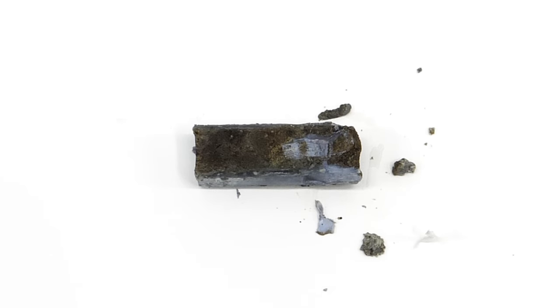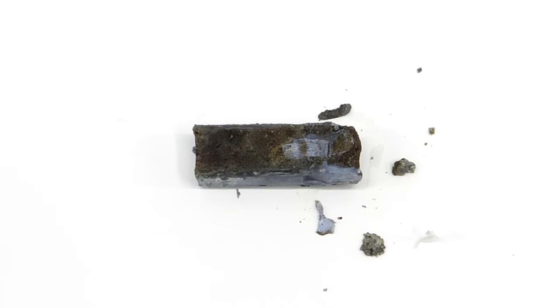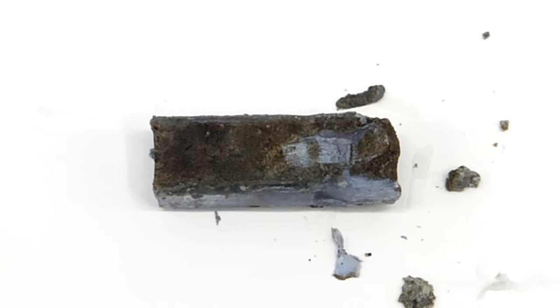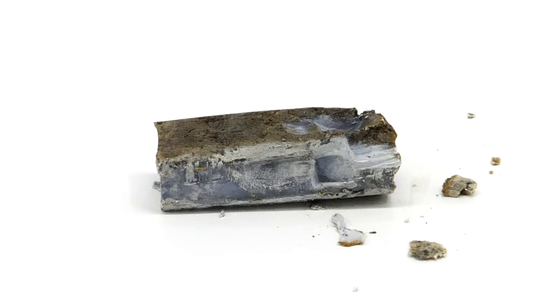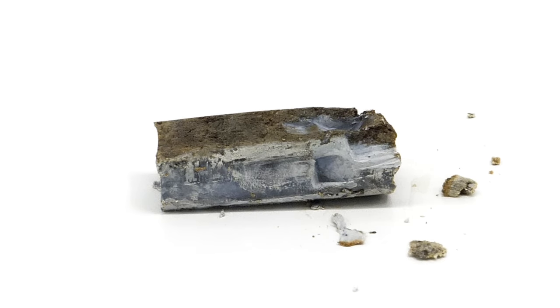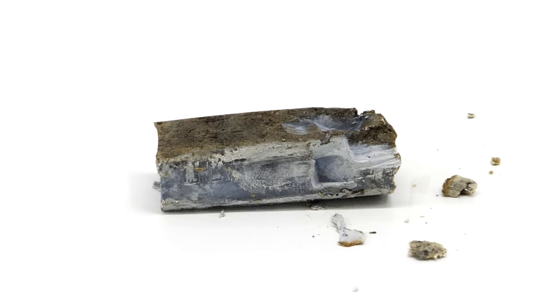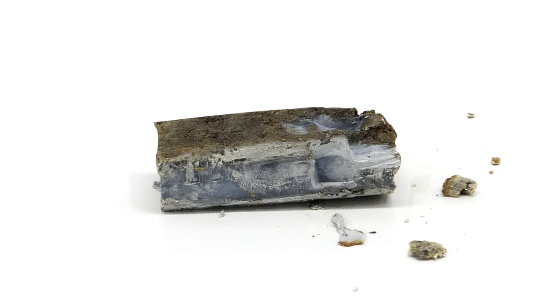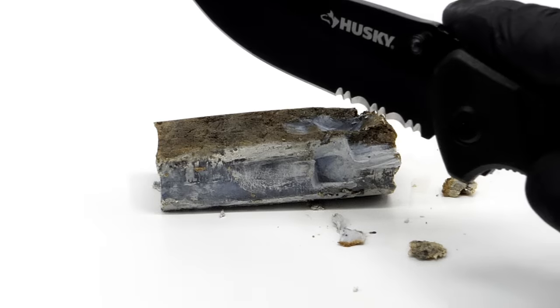What I have now kind of looks dirty and gross, but it's actually just potassium metal. It only looks dirty because it's so reactive, and it has reacted with some moisture and oxygen.